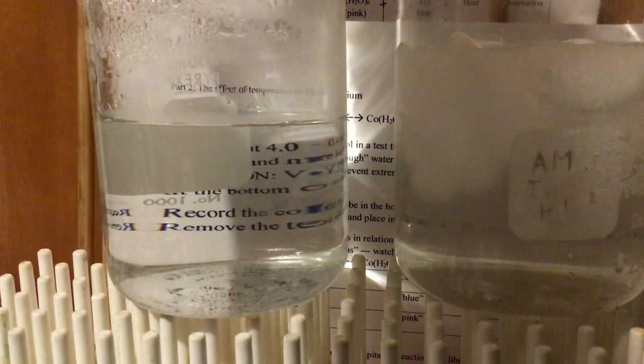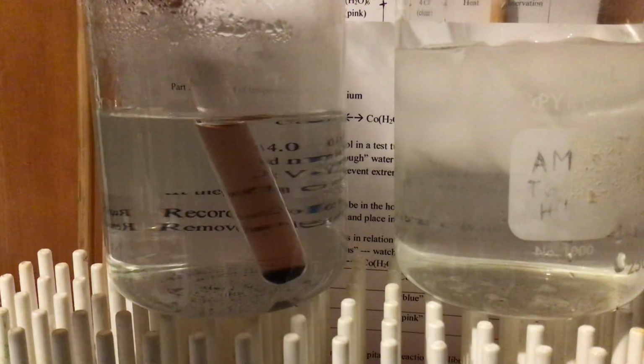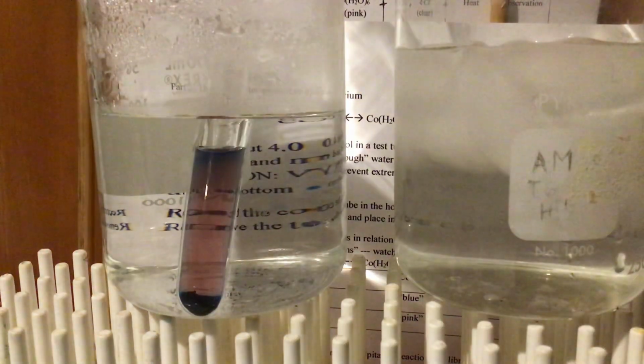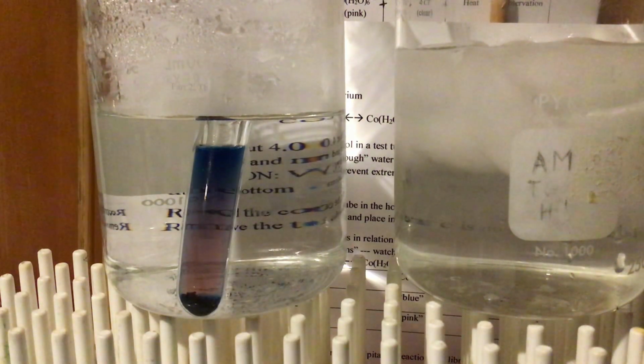And I'm going to take this substance, and hopefully you can see that here. It looks kind of pink. I'm going to put it in the hot bath, and let's see what happens to it. I feel like I'm creating all kinds of nasty shadows here, but let's see what happens as, it looks like twilight, changing to nightfall.